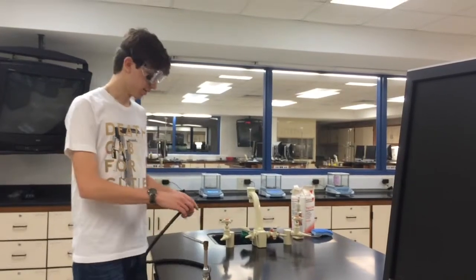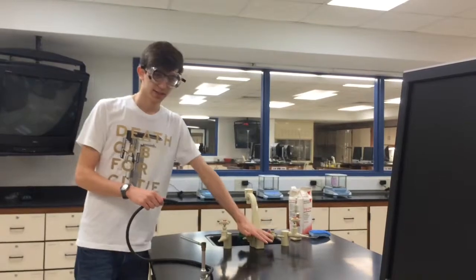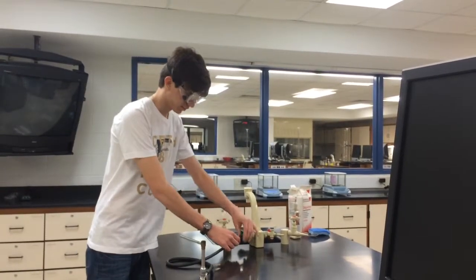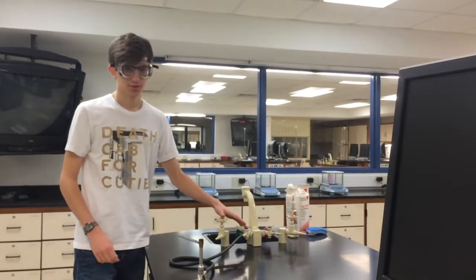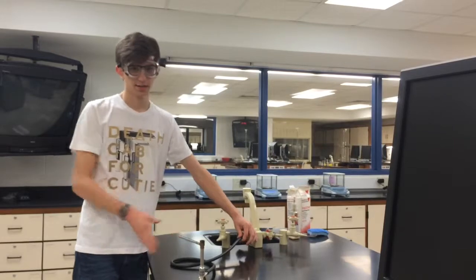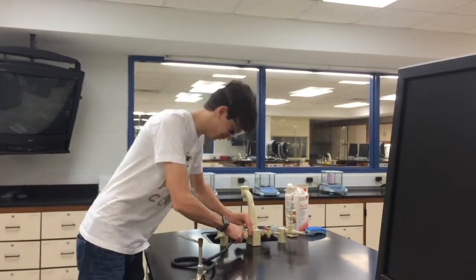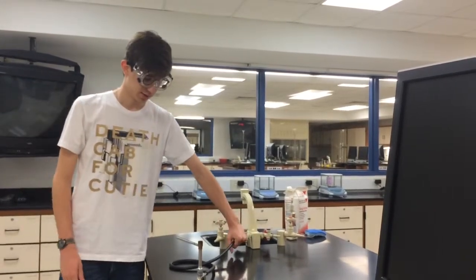So step 2, make sure that you put the tube on the gas nozzle and not the air nozzle. They have it labeled right on top, so just double check that. Having it on air is not a very good idea. It may start a flamethrower. So shove it on there and make sure it's tight on.